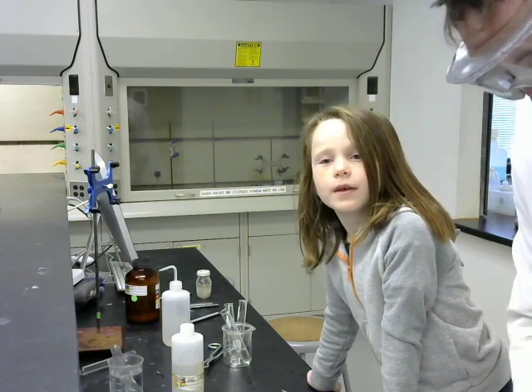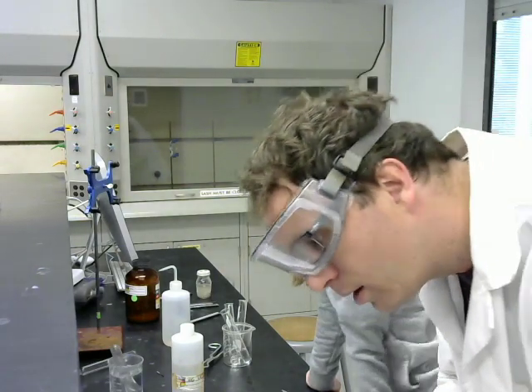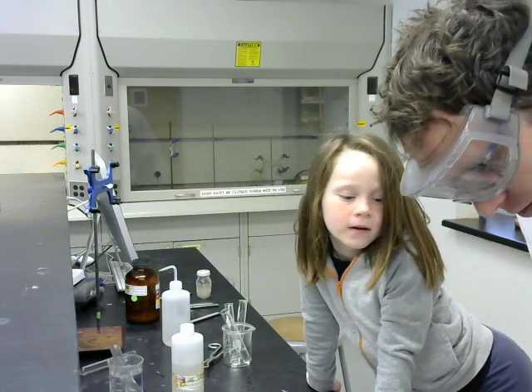Daddy, they don't see you that much. Oops. No, they do. Well, I lost that piece. I'll cut another one.